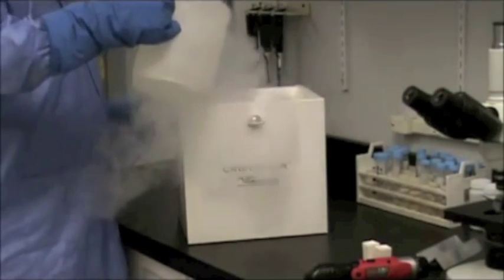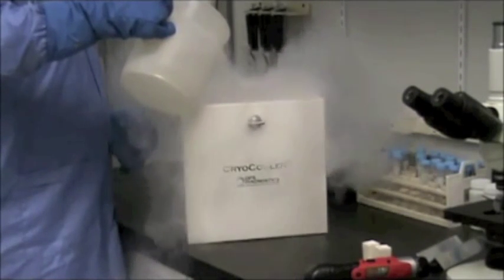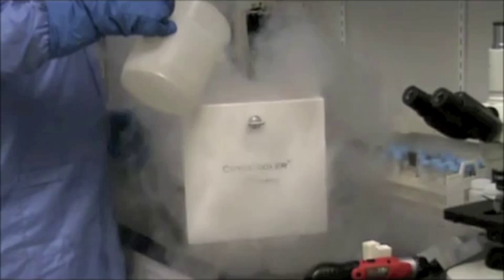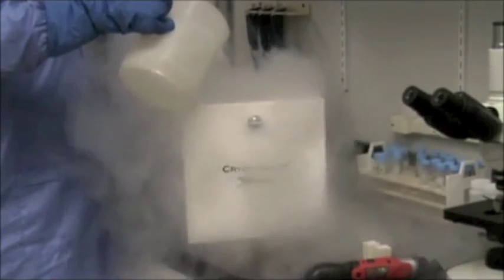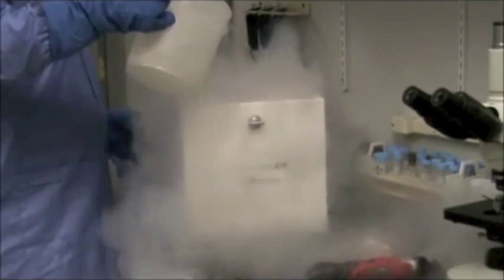The Cryo Grinder needs to be chilled before use. This can be done by placing the mortar and pestle into a pool of liquid nitrogen or by placing in a cryo cooler that has been charged with liquid nitrogen. Allow the mortar and pestle to chill before use.